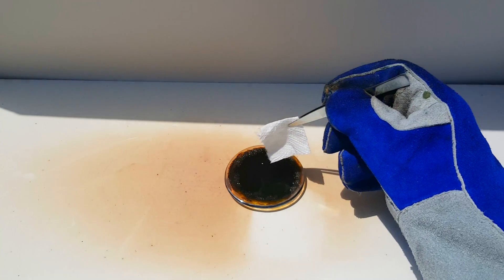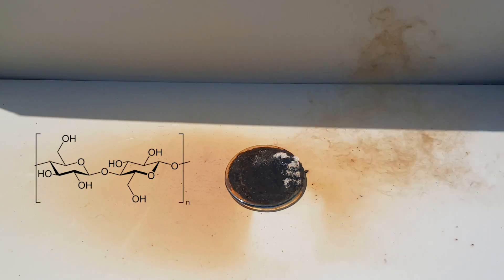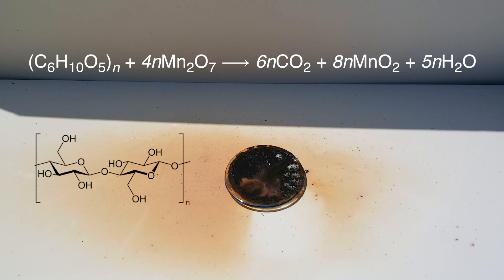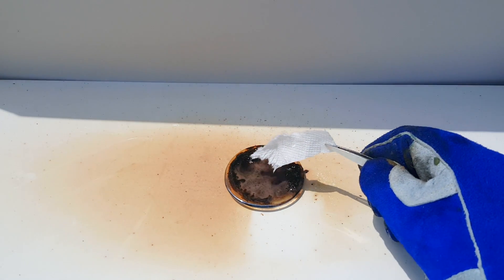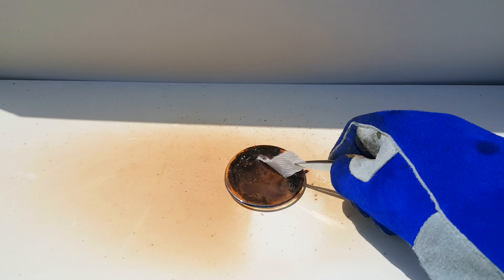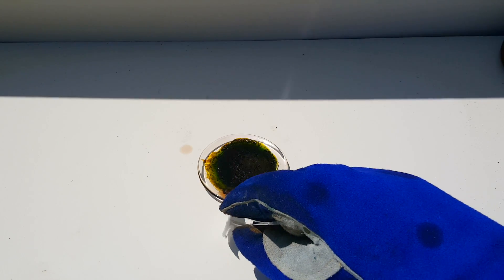Next, we have a piece of paper towel. Paper towels are primarily composed of cellulose, which is an organic compound with many linked chains of D-glucose molecules. The overall reaction is as shown, with N representing the amount of linked glucose molecules. At first, I used the dirty Manganese Heptoxide sample from a previous run — it's interesting how the paper towel just seems to melt away and dissolve into the liquid. When I used the new sample, the paper towel reacted much more vigorously and temporarily burst into flames.